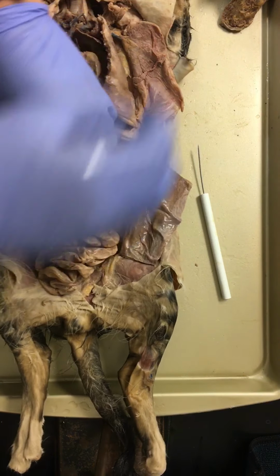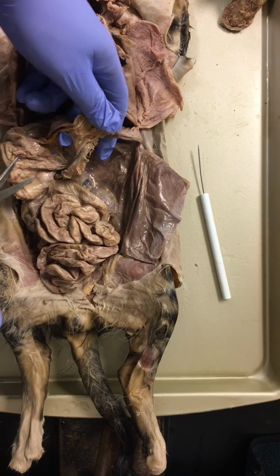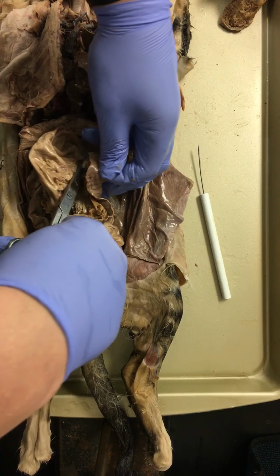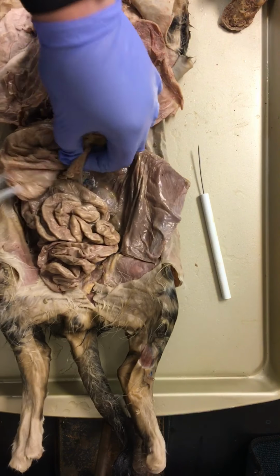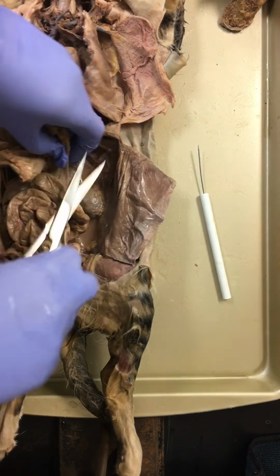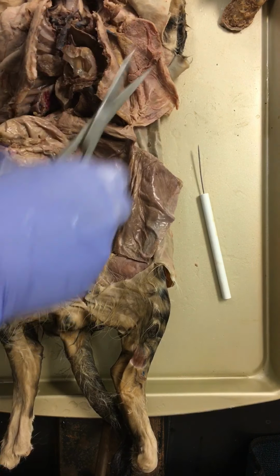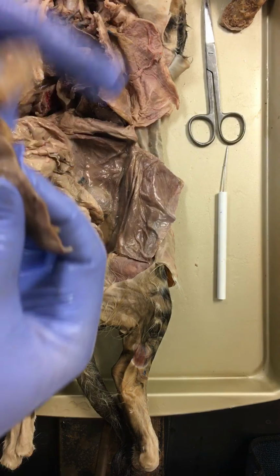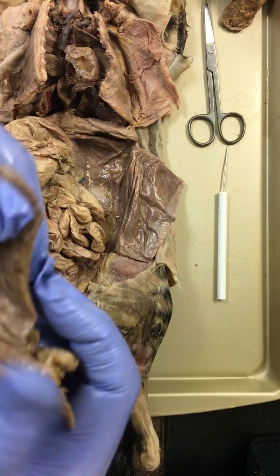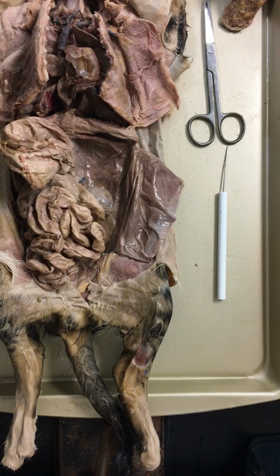And so we're going to finish cutting out our spleen here. Notice with all the organs, there is a layer of fat that goes with them. That's not unhealthy. Fat is good for you. In fact, these organs need that fat to maintain normal metabolic processes. And so with this, we're going to get that spleen out of here. And so we can see the spleen right here. So this isn't inflamed. It's a pretty normal looking spleen. It looks really, really healthy. So that's a good sign for this cat that it wasn't ill before it died.